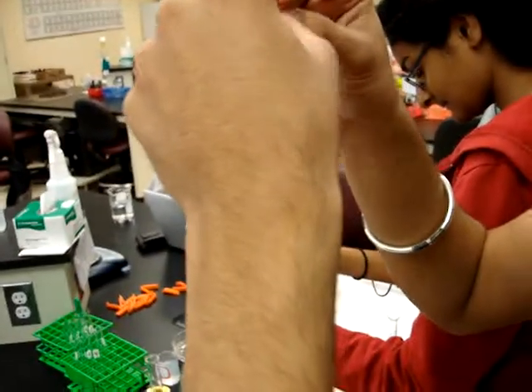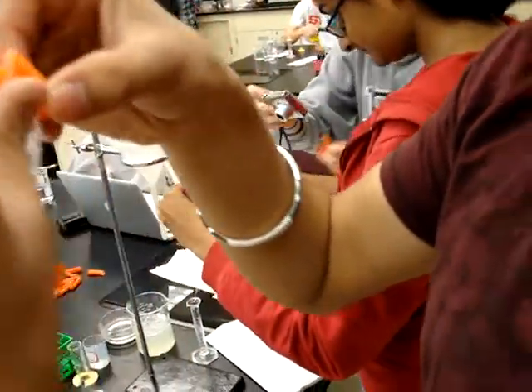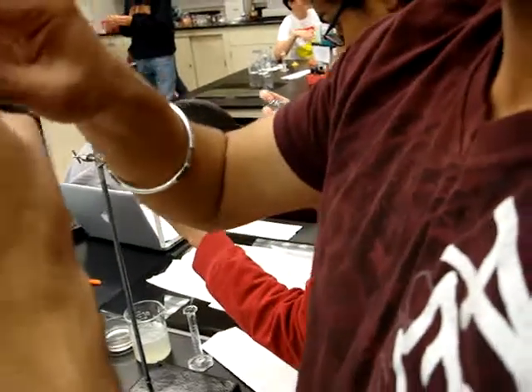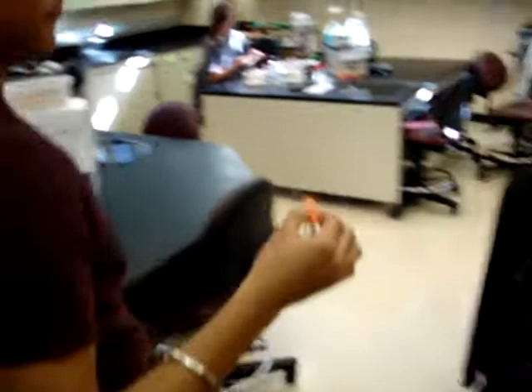Make it thin with larger folds. That should be good. We're going to use 200 milliliters of water.